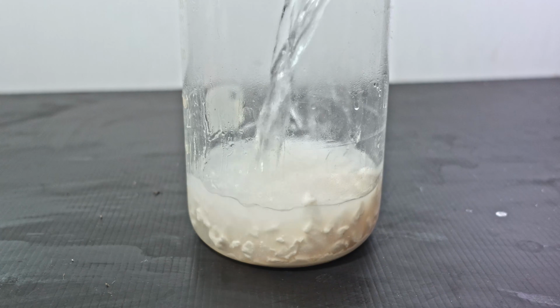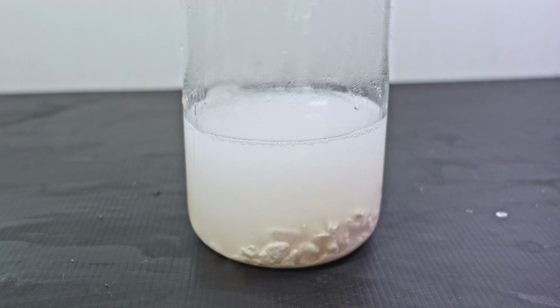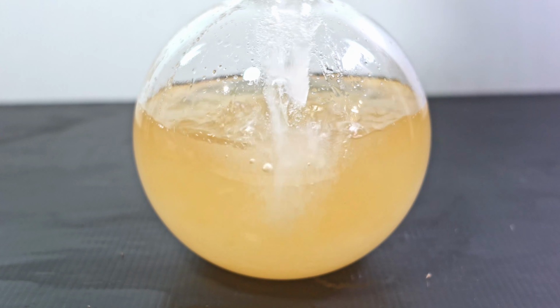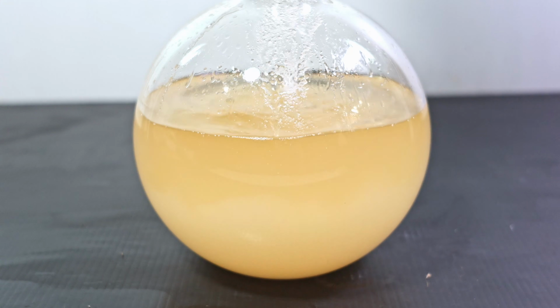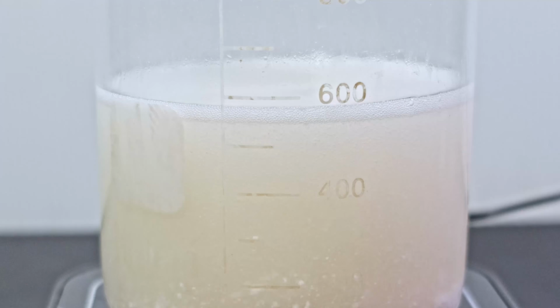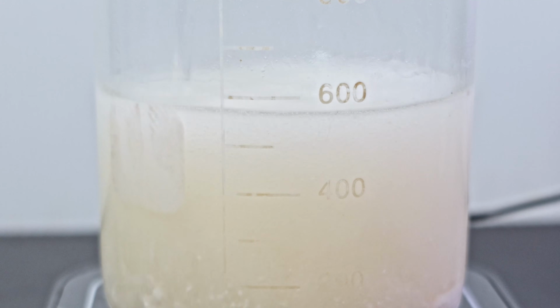When I add water, the solution doesn't heat up at all. That means there are no strongly basic substances like an alkoxide or even a hydroxide. The orange solution is mildly basic, but adding salt water and pure salt doesn't cause any separation. Back to my other solution, I add some acid just to see what it does. Those bubbles and frothing tell me what I have is predominantly potassium carbonate.